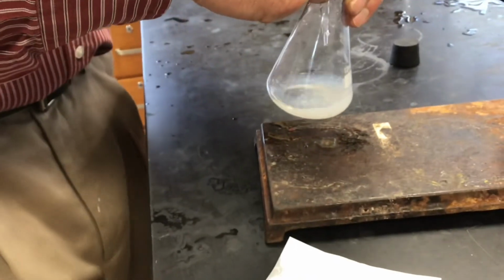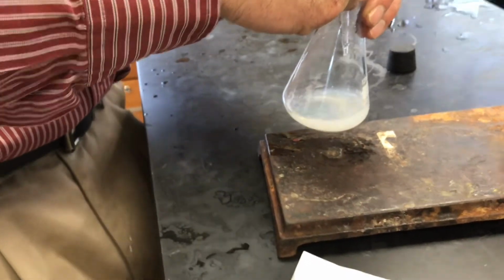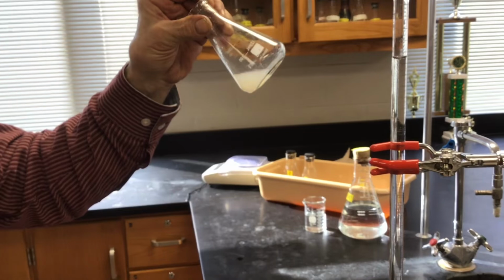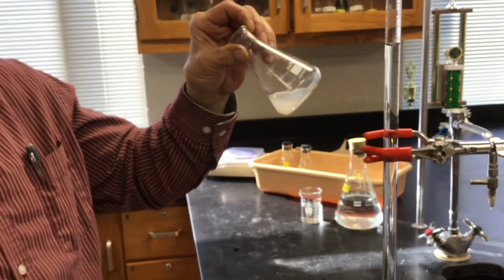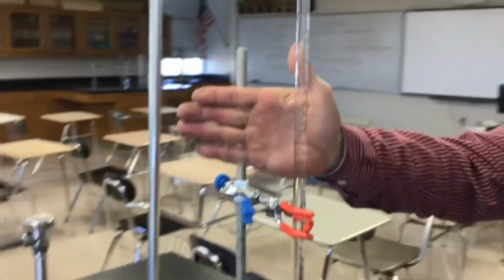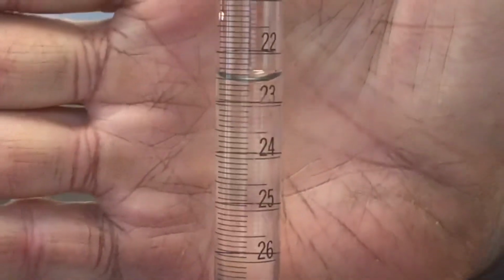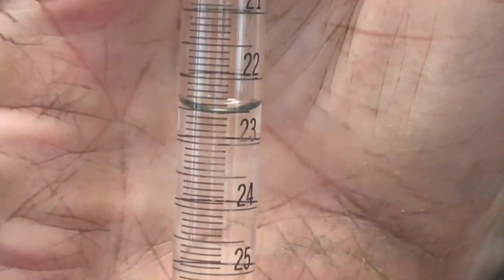It starts to look clumpy. You see how close it's gotten, chunky like that? I'll go with that. All right, look at it here. It still looks white. All right, thiocyanate concentration.